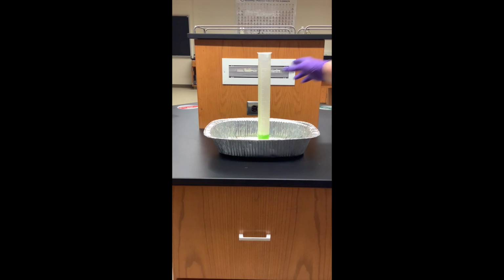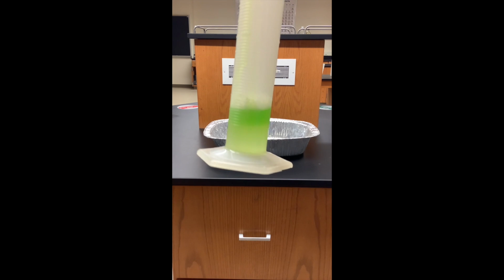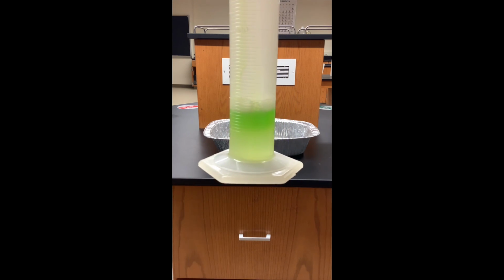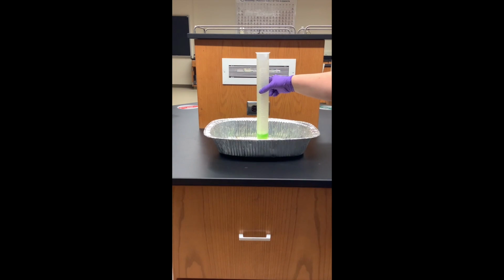So inside of the container, you can see there's a little bit of bubble formation. I don't see new bubbles forming rapidly, so that's mostly from me just disturbing the soap layer. So without a catalyst, the reaction is occurring. We are getting some oxygen bubbles forming, but it's so slow that we're not really seeing it in real time. If I add a catalyst, in this case I'm going to add saturated potassium iodide solution. It's saturated, so it has high concentration, but a little bit of catalyst is going to affect the rate dramatically. So I'm going to add my catalyst and see how many bubbles are produced.